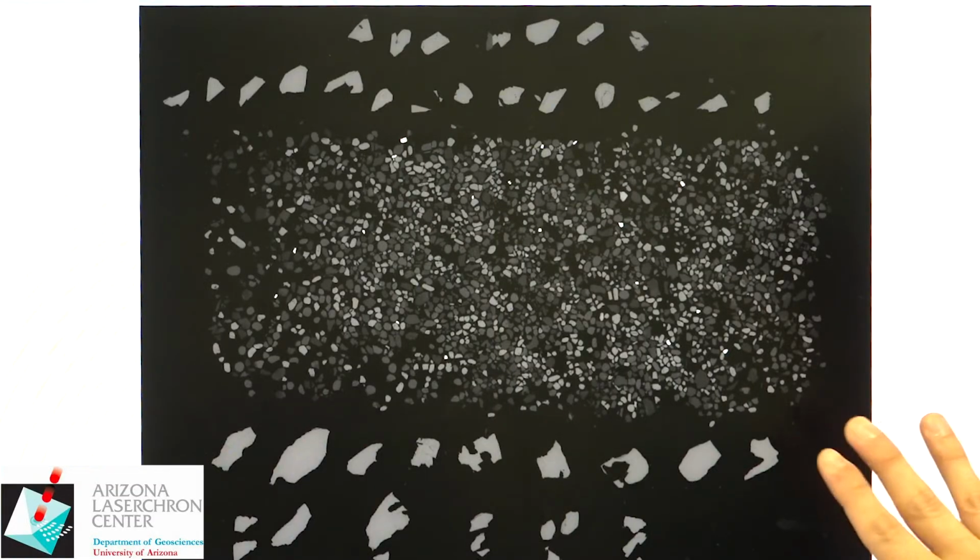First, we'll go over the backscatter images. So the image you see on the computer monitor right now is what the raw backscatter image looks like. It gives you different grayscale values based on the average atomic Z of the entire mineral. So for zircon, it is more or less just reading us a response back of the zirconium and silica and oxygen within the crystal itself.